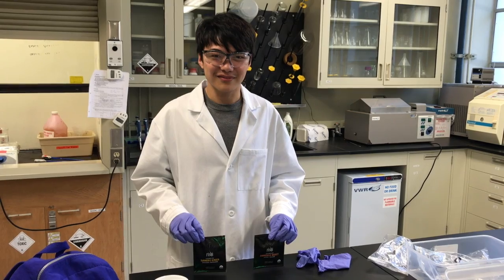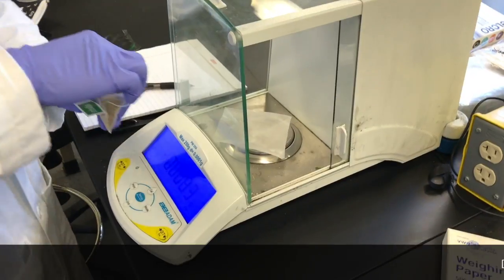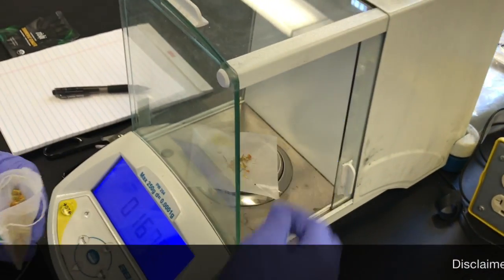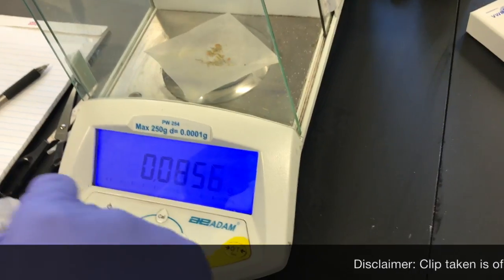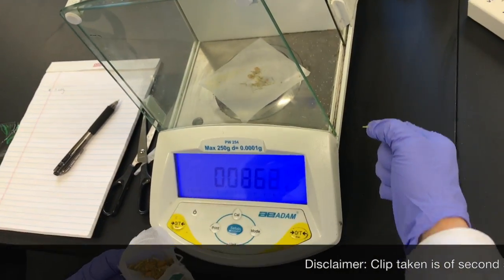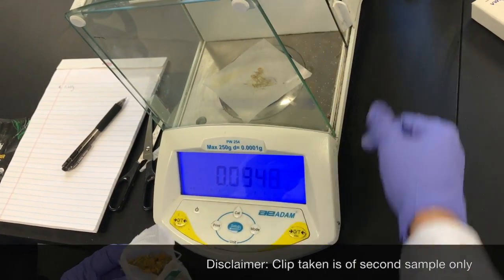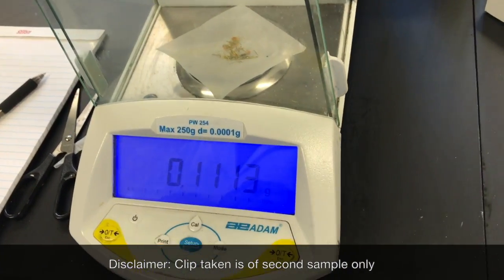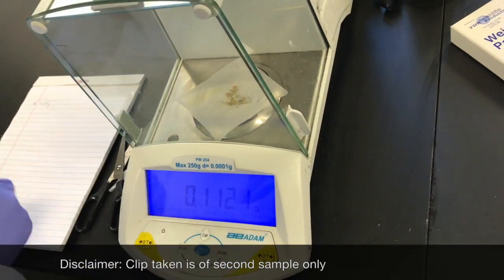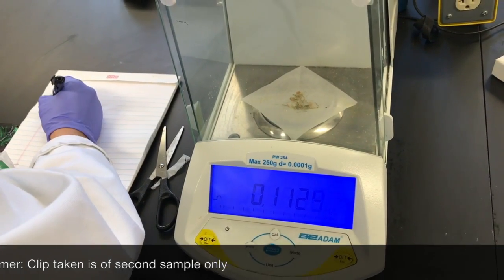As a start, this is a bag of turmeric ginger tea brought from RTH Cafe. First, cut the tea bag open to weigh out a sample of roughly 0.1 to 0.12 grams. We are first going to place this weighing paper on the scale and zero the scale. Then we will carefully place tea leaves onto the weighing paper until it reaches a mass somewhere between 0.1 and 0.12 grams. This first sample is 0.1030 grams.